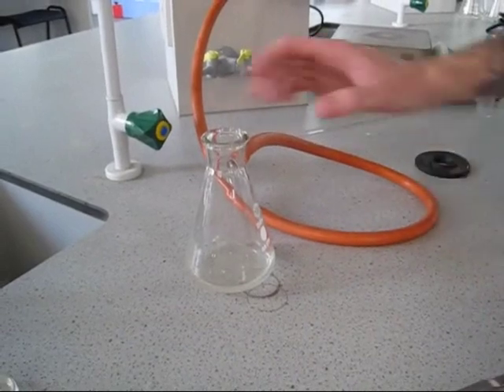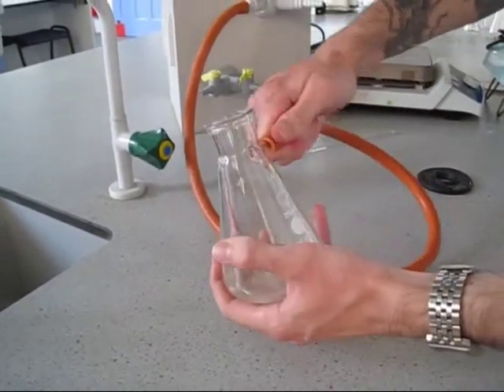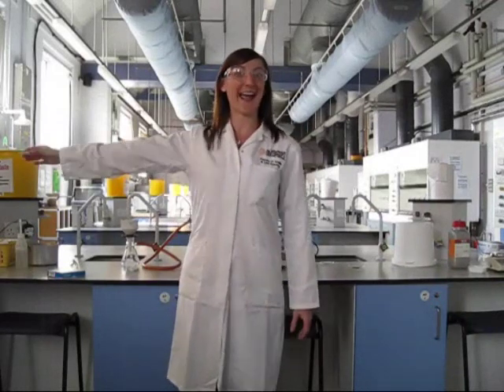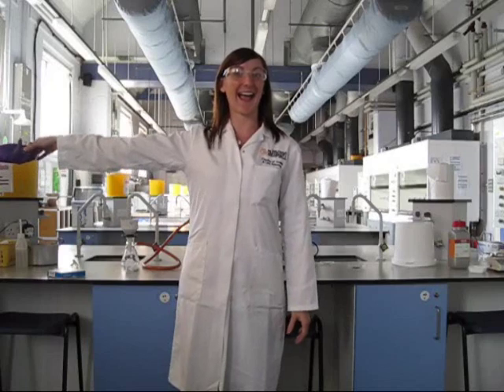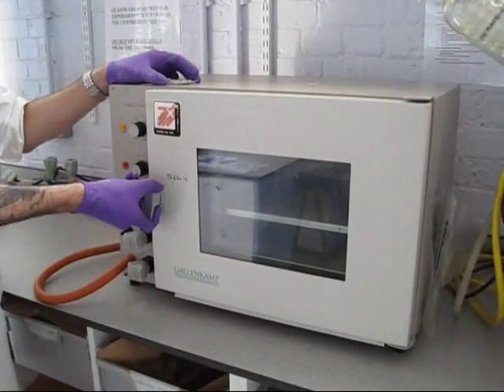Once we've finished with our Buchner filtration, you'll have some water left in the bottom of the flask. This is okay to get rid of down the sink. After we've taken our product from the top of the Buchner, we then need to dry it. The product can be dried in a vacuum oven.